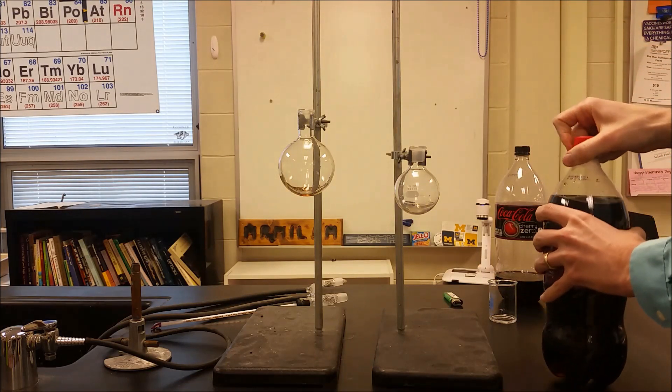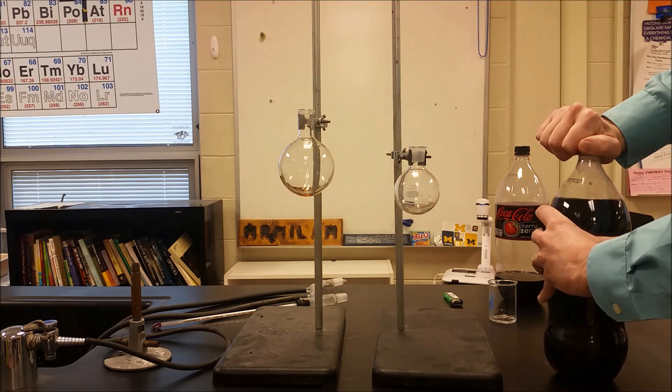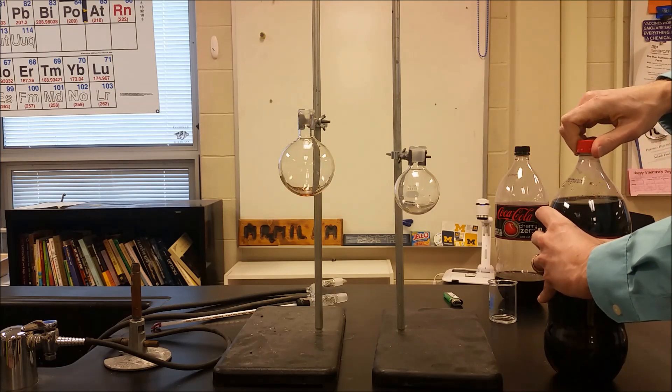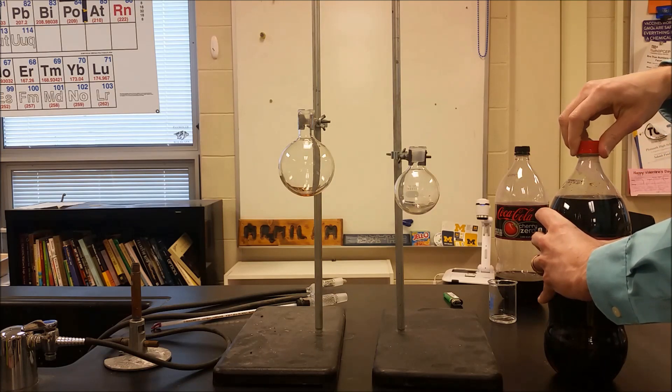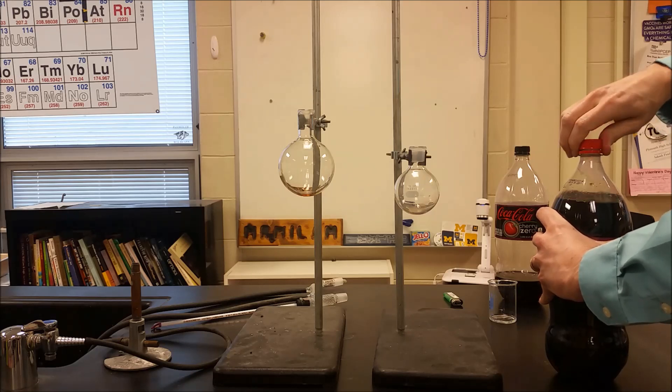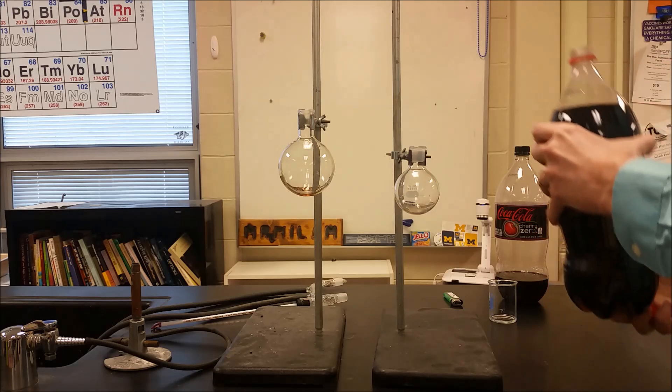Alright, so we're going to open up some fresh cherry Coke here. That's going to be a little bit of a problem because there's going to be so much CO2 dissolved in here that when we heat it, it's going to take some time to get rid of that. We'll persevere nonetheless.